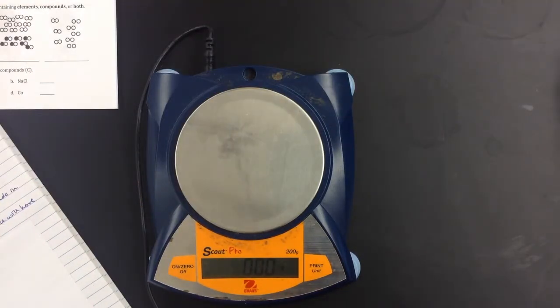Okay, now for each of those you need to compare the mass of just the substance to the mass on the periodic table. On the periodic table, you're going to look in the box at the bottom number, the one that's a decimal. That's the mass you're going to compare it to. You're going to compare only the ones that are elements: aluminum, iron, copper, sulfur, zinc, and magnesium.